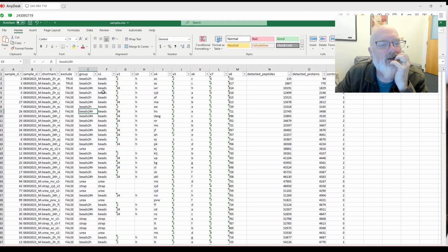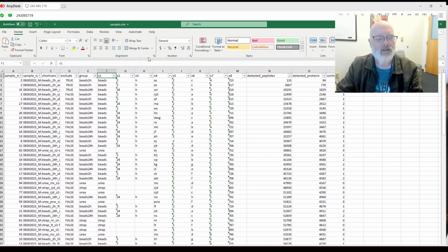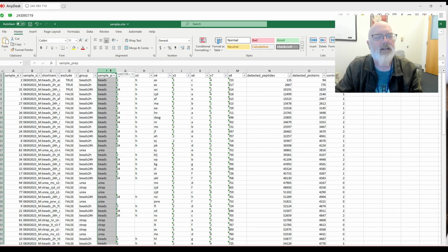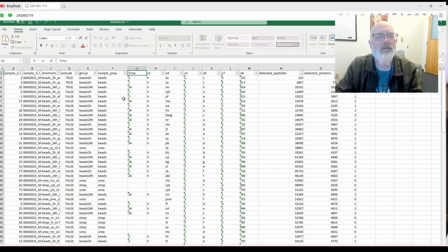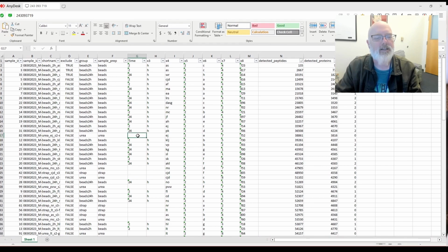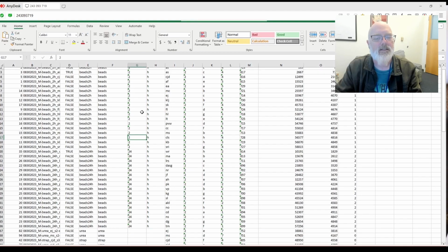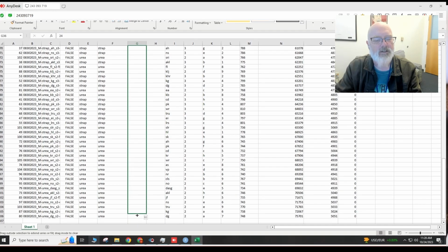And this is group. We could change x1 to group, and then we could change this into sample prep, we'll call it. So that would be all beads first, urea and S-trap. And this could be time. That would be 2 hours, 24 hours. And I believe the urea was overnight. So we could sort by C, and all of these others were done overnight. So this could be like 24 hours.